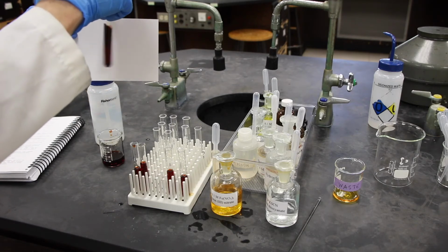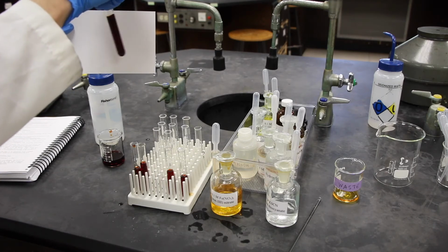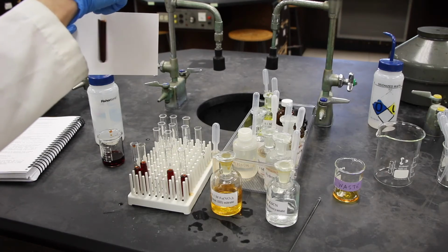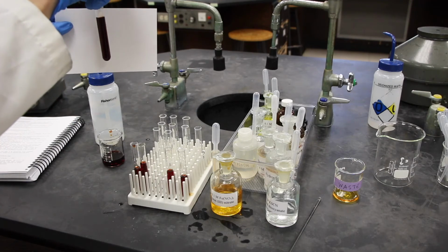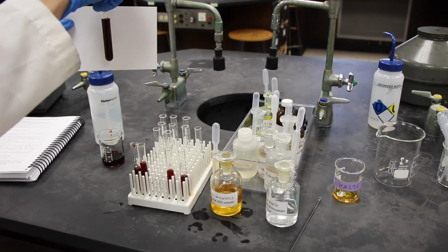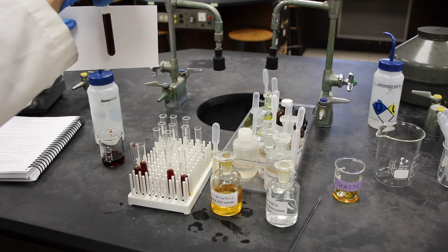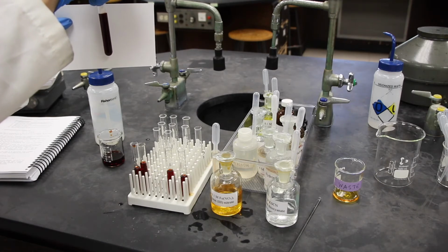Again, potassium thiocyanate, K plus, and the thiocyanate ion. Do you see either one of those in the balanced net ionic reaction, or could one of those react with one of those in the balanced net ionic reaction? And you can do your observations and data. Record this in your data sheet. This is test tube 3.